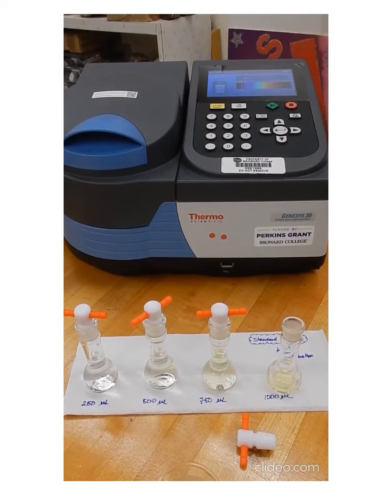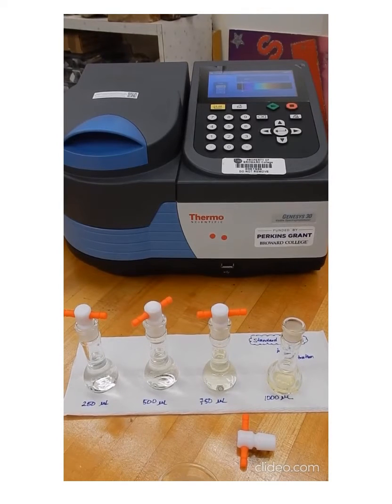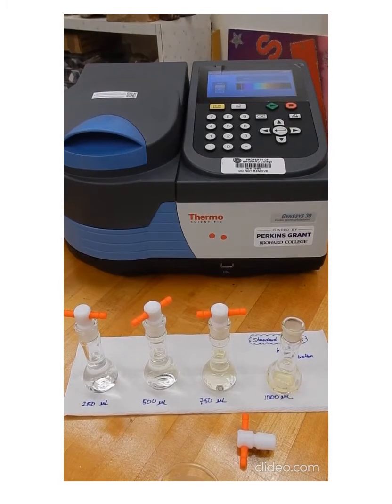Now, we're preparing the graph because we're actually trying to determine the concentration of the chromate ion in an unknown solution. That unknown solution that we have is just a solution that we're preparing by dissolving silver chromate. The silver chromate is insoluble, so we're trying to determine how much of that insoluble compound is actually dissolving in water. And with those concentrations, we can calculate the equilibrium constant, or the Ksp, for this silver chromate compound.